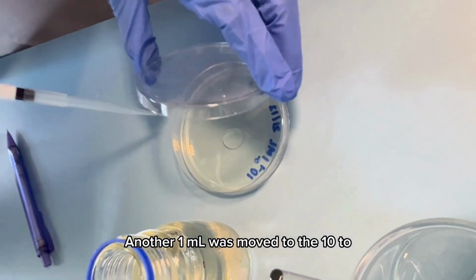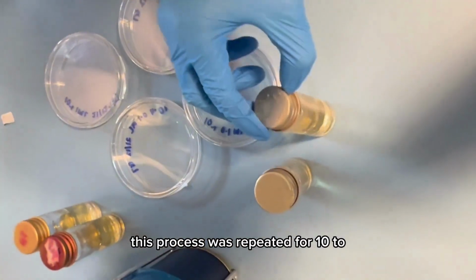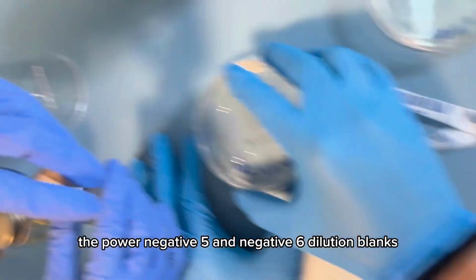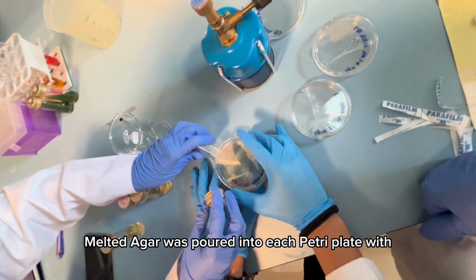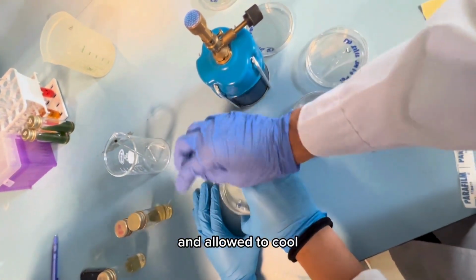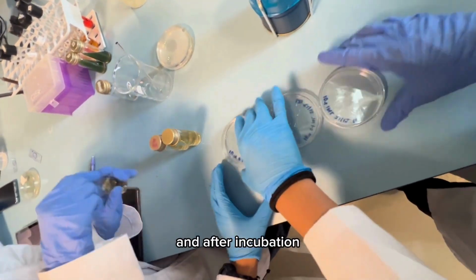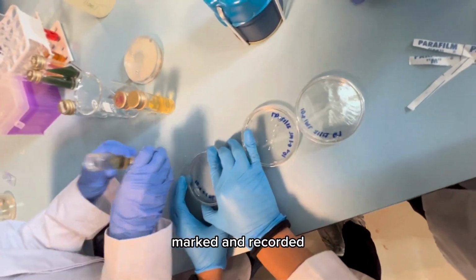Another 1 ml was moved to the 10 to the power -4 dilution blank. This process was repeated for the 10 to the power -5 and -6 dilution blanks. Melted agar was poured into each petri plate with sample dilution, mixed and allowed to cool. Inverted plates were incubated at 30 degrees Celsius, and after incubation, colonies were counted, marked, and recorded.